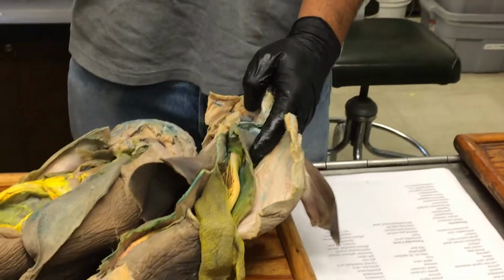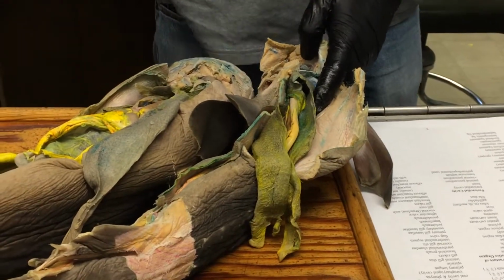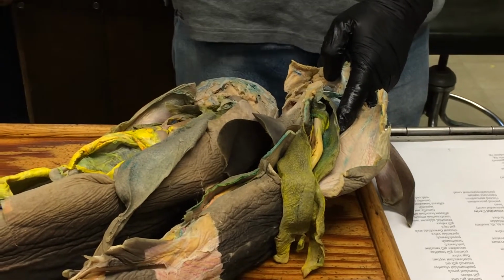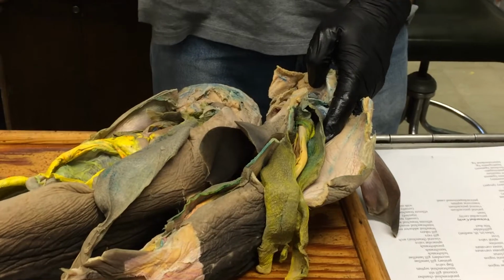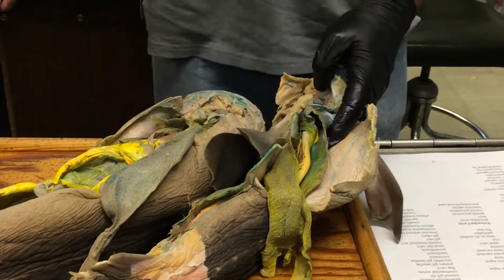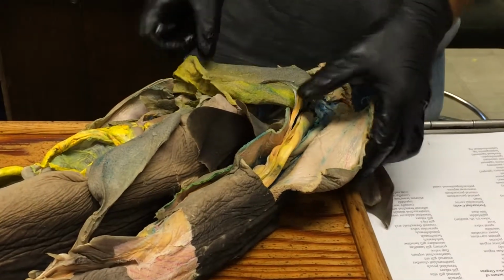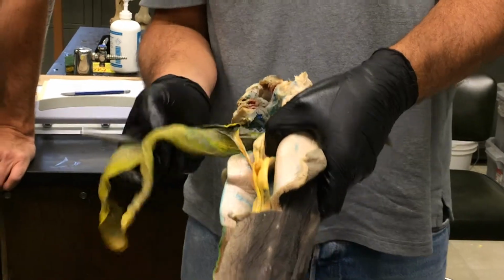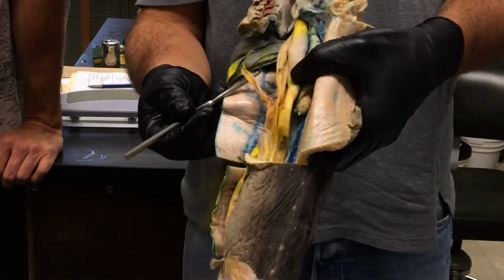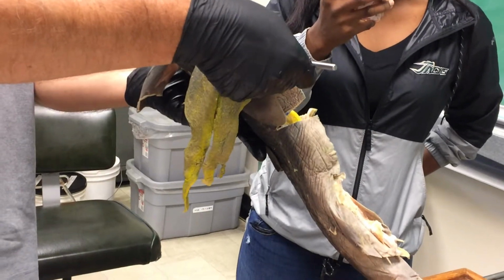The other part then is the, and you can look at my little diagram there, see? Falciform ligament between liver and ventral body wall. What's the part between the liver and the gut? The lesser omentum. So this is always a little confusing to people because they're like, oh, there's nothing there. But here we go. Here's the liver. Here's the stomach. Do we see anything connecting them? Yep. Oh, wow. That is the lesser omentum.